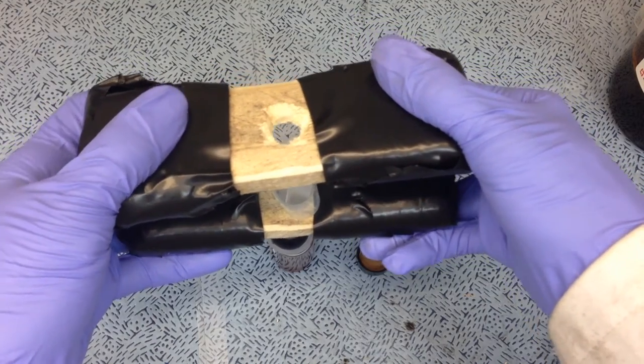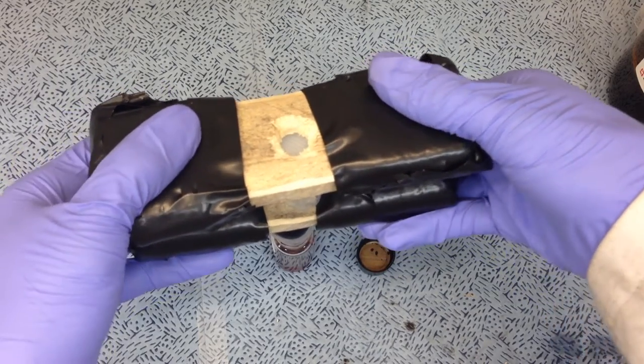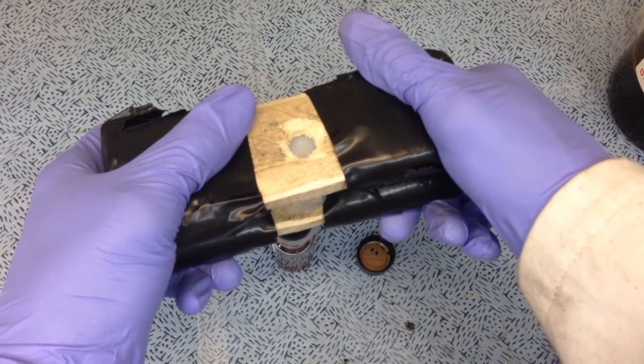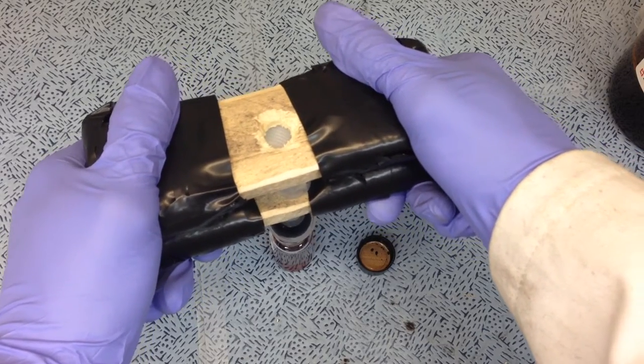And all they are is just two pieces of wood with holes drilled in the middle. In the top, that doesn't need to be a hole, it's just a little cup that holds the top of the plunger. And a little bit of paper towel and electrical tape padding on the sides helps make it a ton more comfortable.